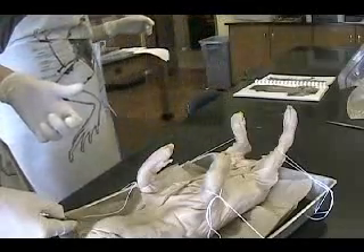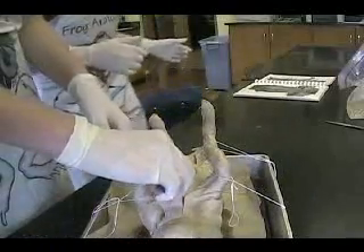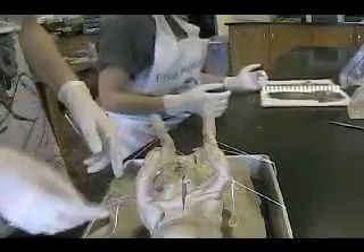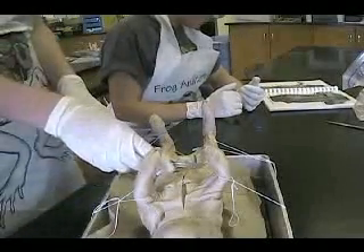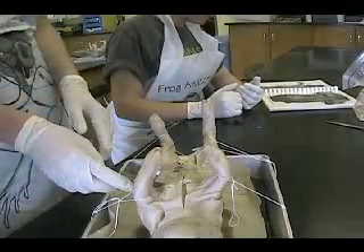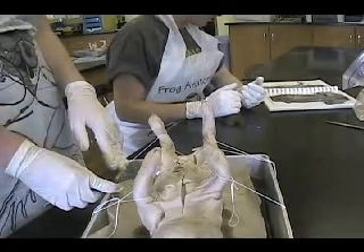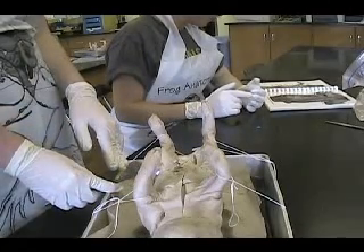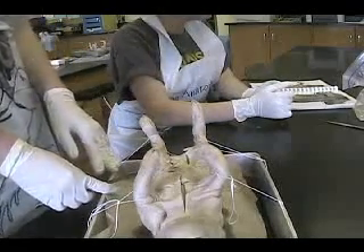Do you have a question? Right here, I'm hitting my bone. This is bone right here. I'm looking at it — it's like only right here is where they're able to cut. They're cutting right here. Maybe cut a little too hard. Okay, on the other side.